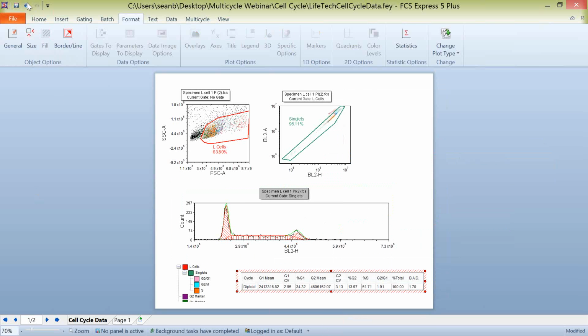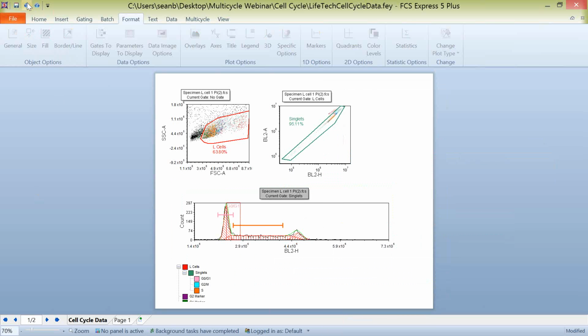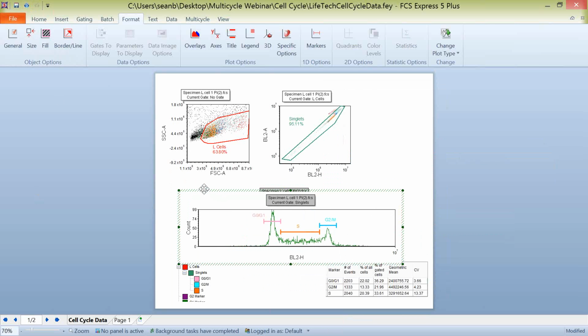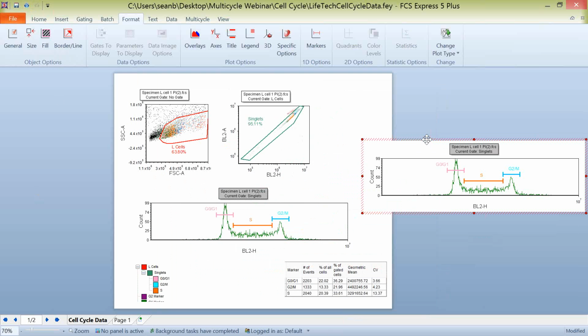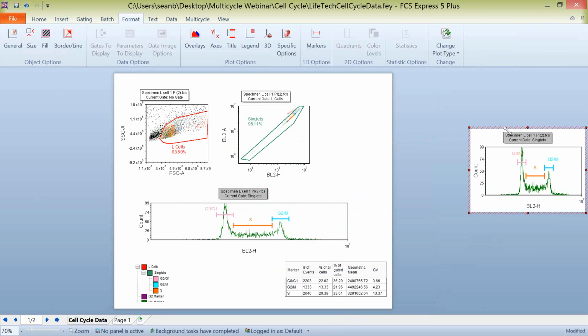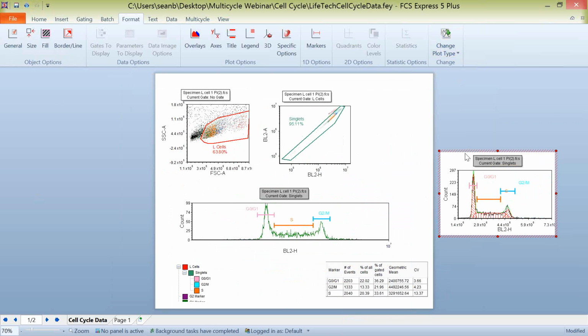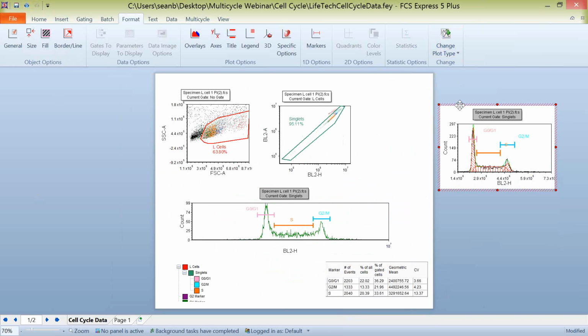And again, you don't just have to use one or the other. If I do a few undo steps here, we get back to our histogram. If we really wanted to compare these things side by side, we can simply put our multi-cycle plot over here on the right, or the histogram on the right will change to our multicycle DNA plot. And you can see here that here's our multicycle DNA plot.